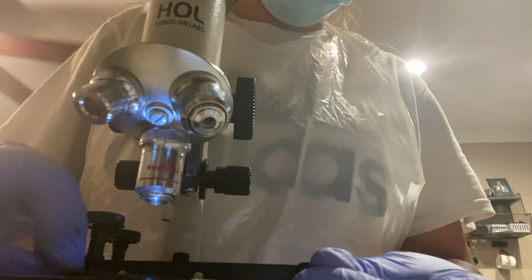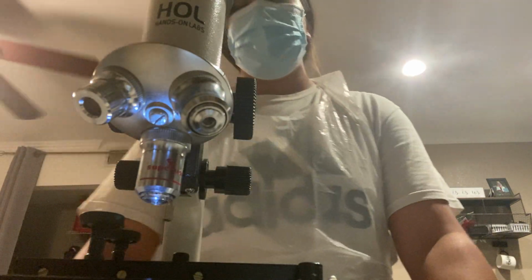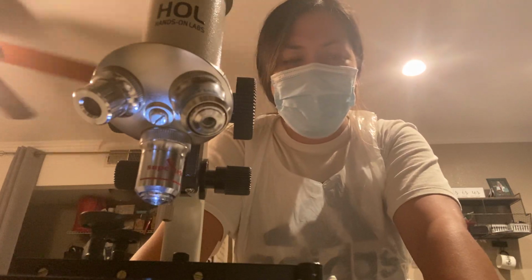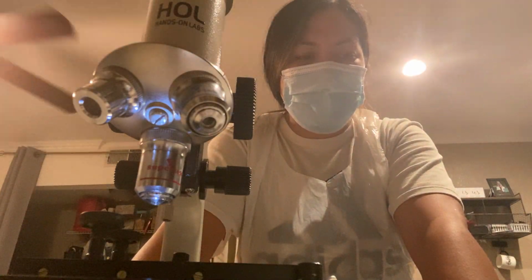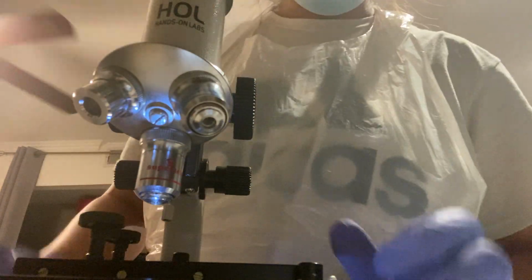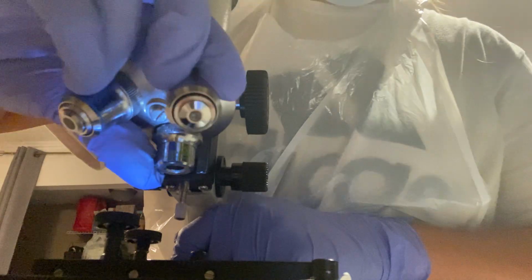With this one, and with the S. epidermidis, it just looked like the cocci shaped bacteria. I didn't see any elongated or spiral shaped bacteria. So it was very scant, very few that popped up, and they were a lot harder to see for some reason. So this is my S. cerevisiae. Let's start on low power.